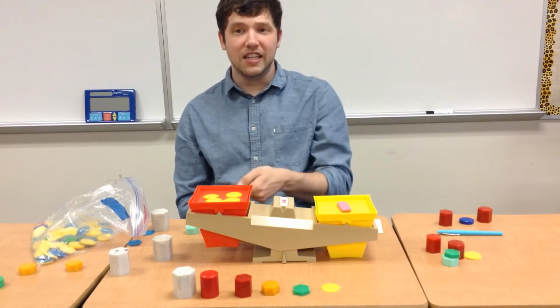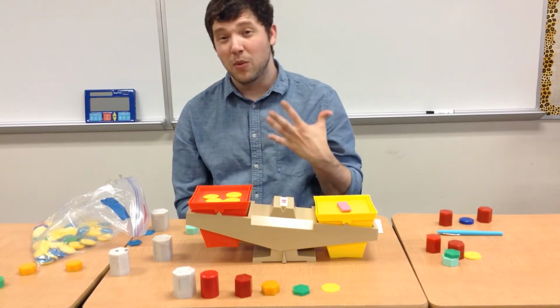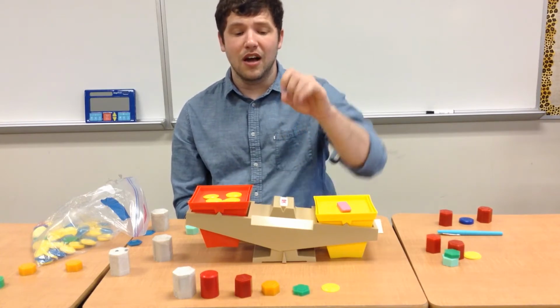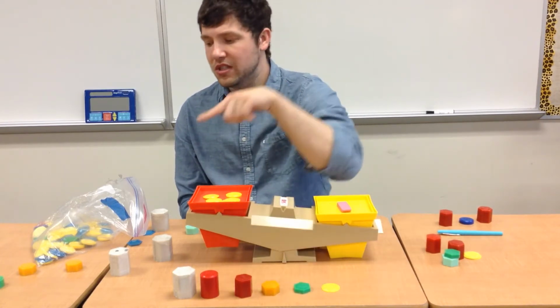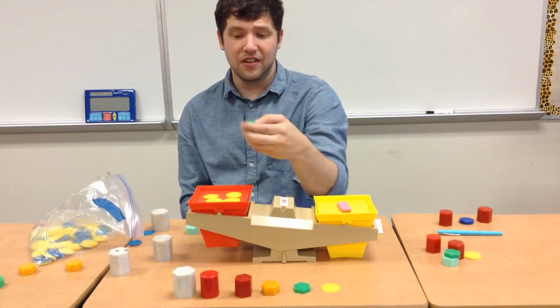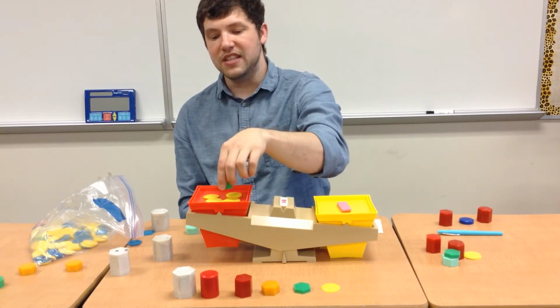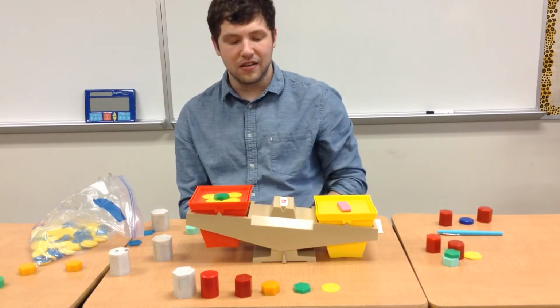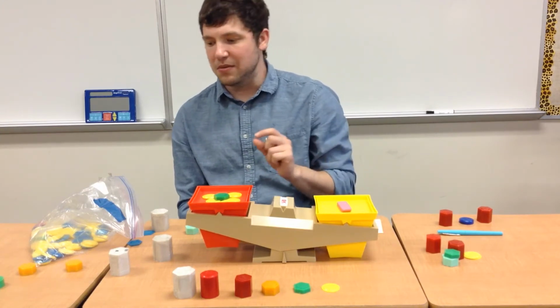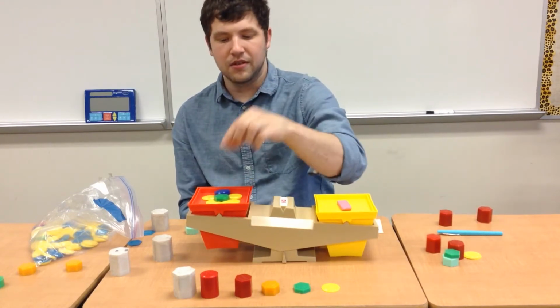So instead of just adding ones and one and one over again, we can begin to add some bigger increments of weighted tools to our red side. So I'm going to add a 5. So I already have 5 ones here. I'm going to add another 5, so I have 10 grams on this side. As you see, it budged a little bit, but we still need to add some more. So I'm going to add another 5 grams.